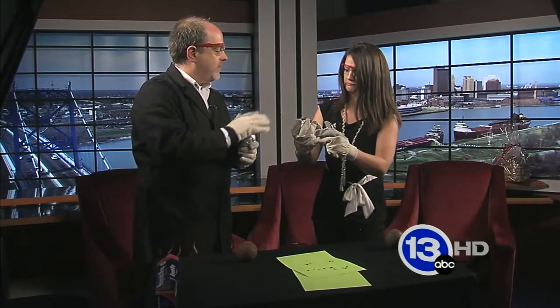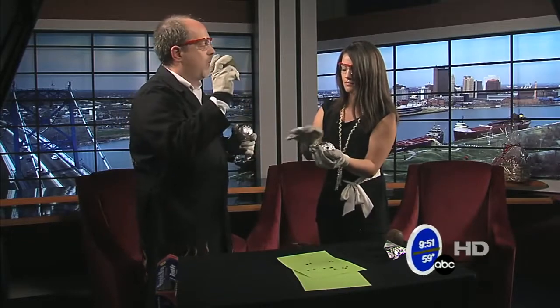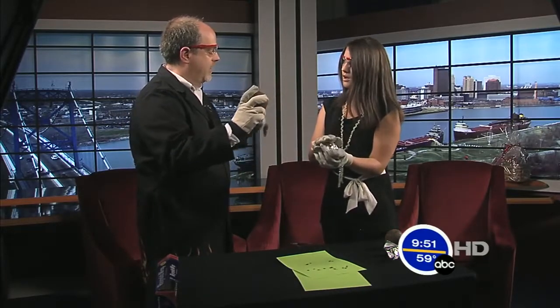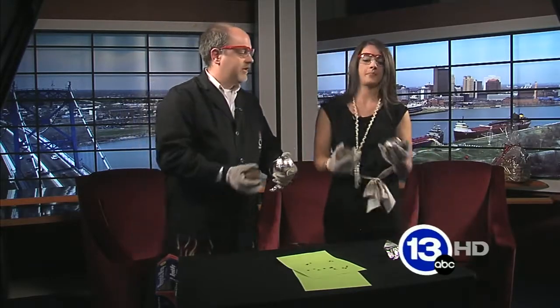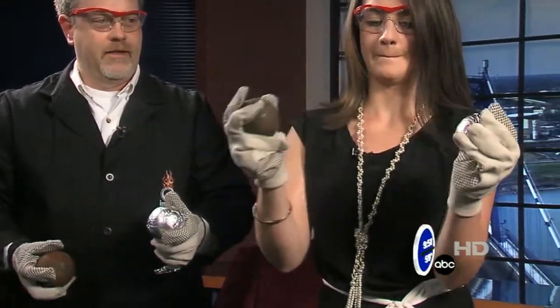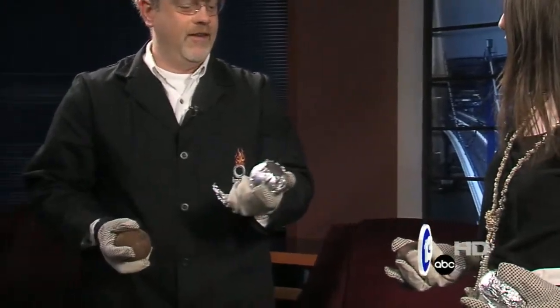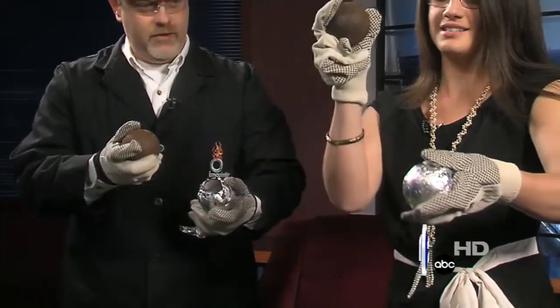What we're going to do now is smash the iron oxide — or the rust — into the aluminum foil. We're going to get a little chemical reaction called a thermite reaction. Go ahead and pick that up and just smash them together as hard as you can without dropping them. Try grazing them together — here's the technique. If you hit them hard enough, you can actually blow the aluminum foil off one.